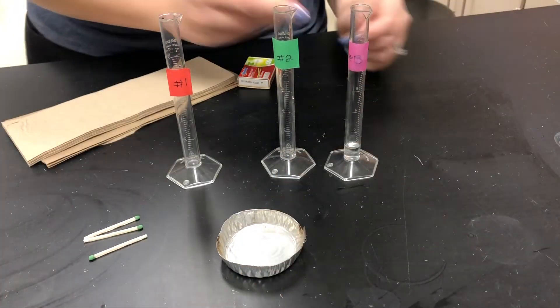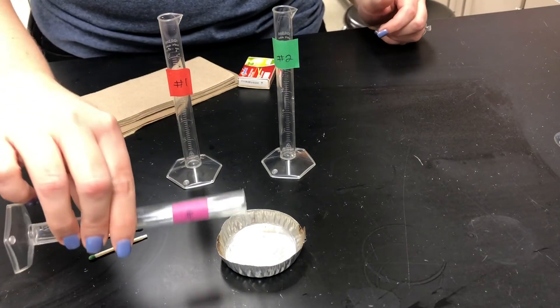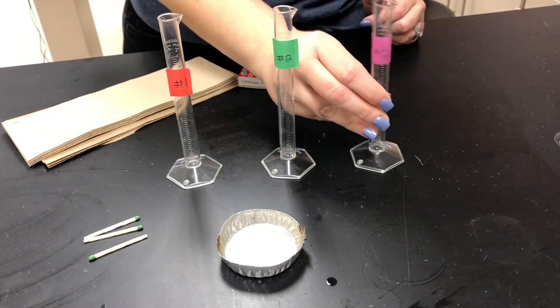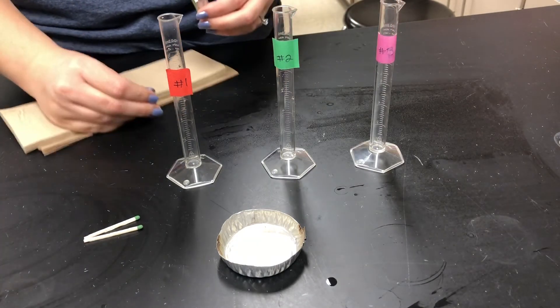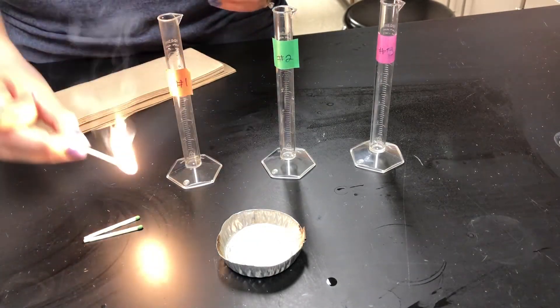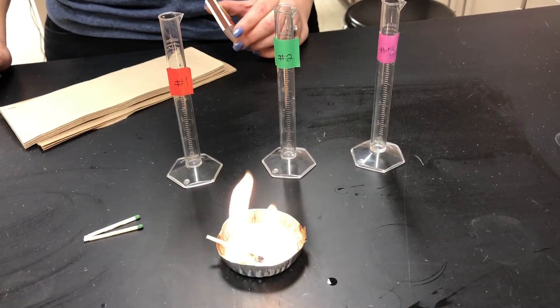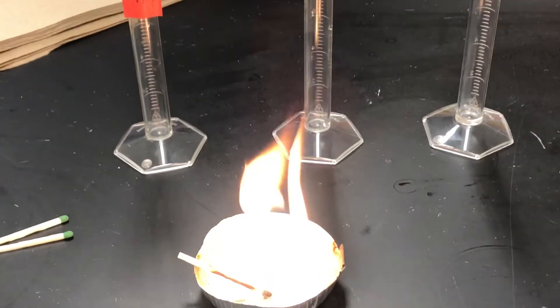Our final test will be for liquid number three. Once again, we are placing one milliliter of liquid number three in the aluminum cup. We will now light our match and place the match in the liquid and observe that our liquid is flammable.